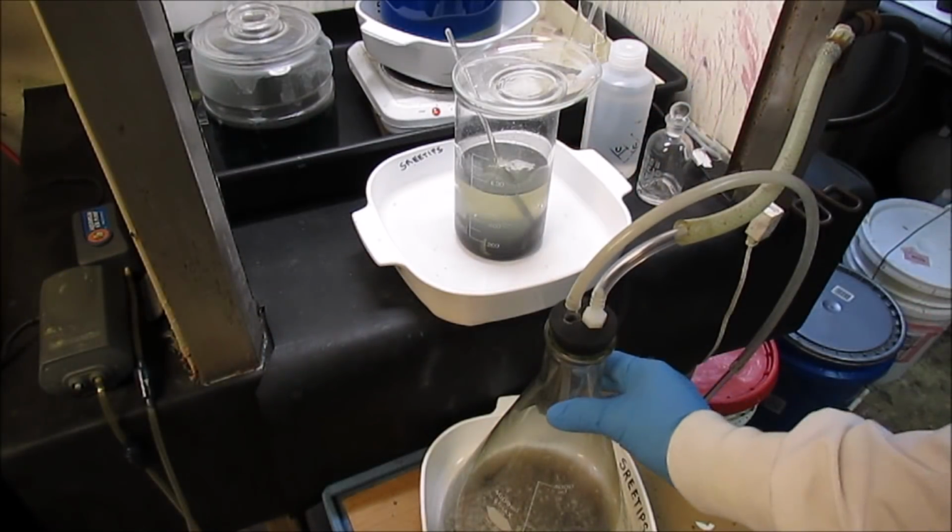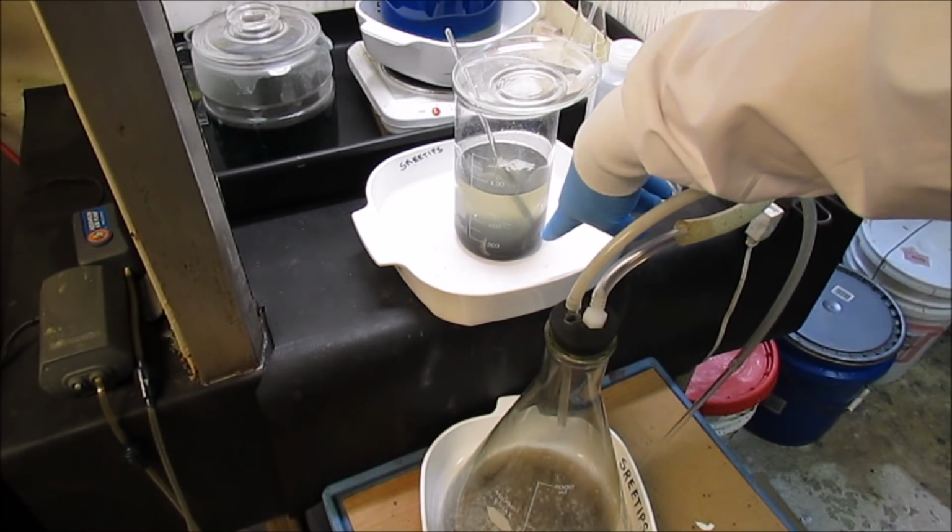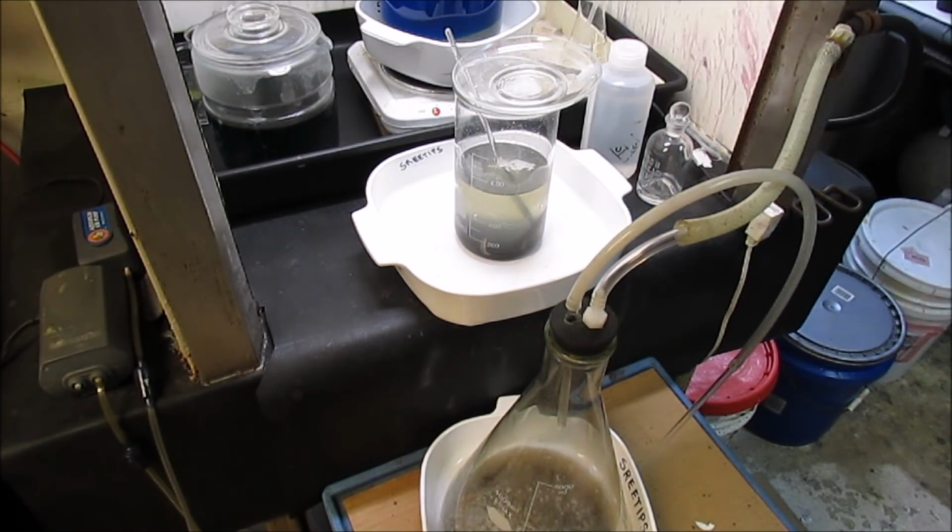Okay, here we go. Part 14 of the stock pot refining series. I'm going to start by vacuuming the solution off of the mixed black PGM powders.